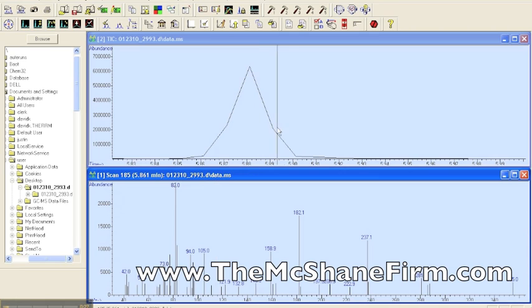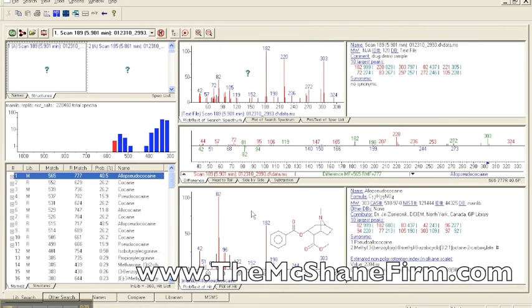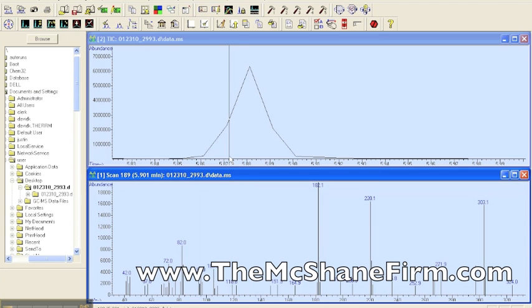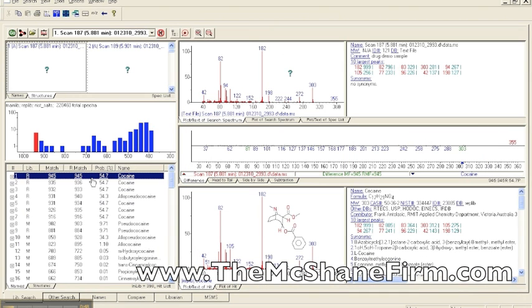So you're inviting a lot of human integrity that goes along with it, because if this was truly a well-resolved peak, then it shouldn't matter where you click on the peak. It should all come up with the same thing. So you go over here and you right double click and allo pseudococaine, but you go over here and it's going to say cocaine. And it's going to give you different match factors, different probability scores that are there.